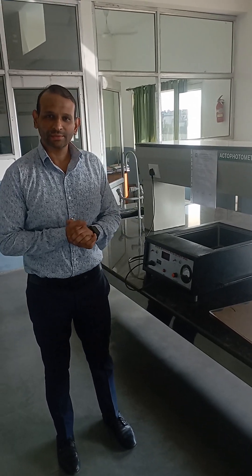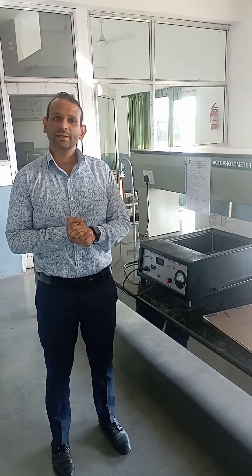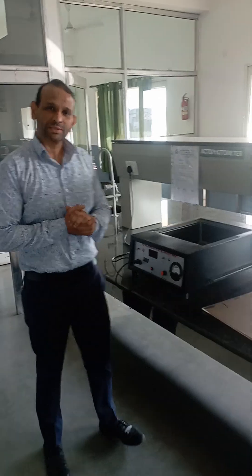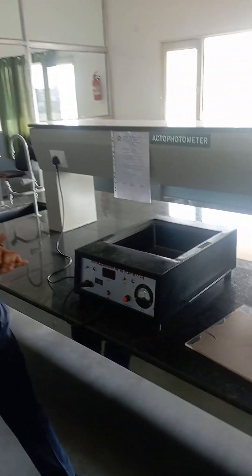Hi everyone. This is Kuldeep Sharma, currently working as Assistant Professor of Pharmacology in Guru Gobind Singh College of Pharmacy. In today's session, we are going to demonstrate the apparatus known as the actophotometer.